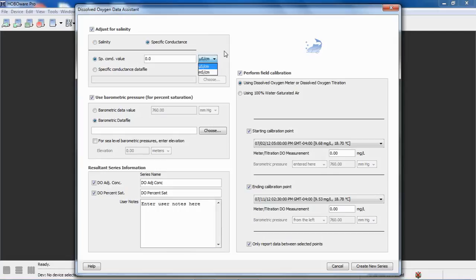You can get salinity or specific conductance from our U24 conductivity logger, or you can use a third-party salinity data file or specific conductance data file and import that into HOBOware Pro, as long as it's formatted correctly according to the formatting guidelines that are spelled out in the HOBOware Pro User's Guide. For this example, we're going to use a salinity data file, which we have. It's a U24 data file.